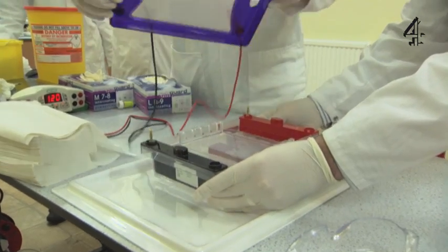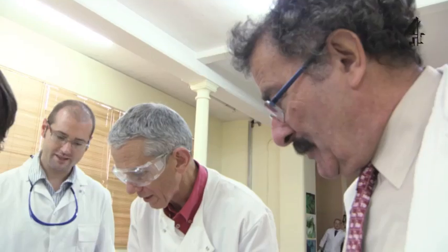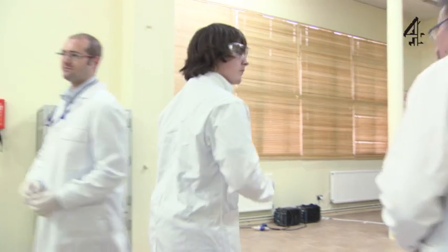That's it. Keep it level. Terrific. Now come and follow it down — we'll have a look at it on the UV illuminator.